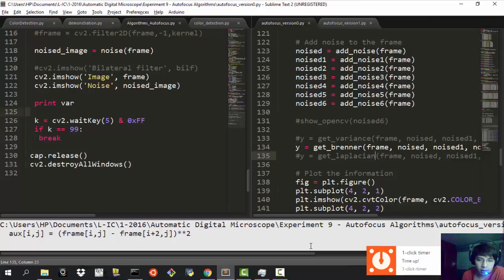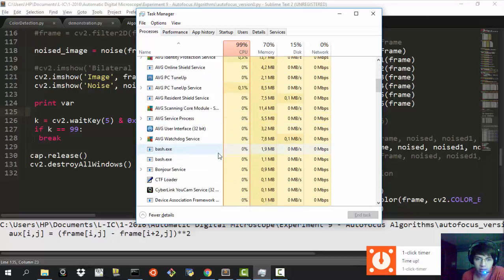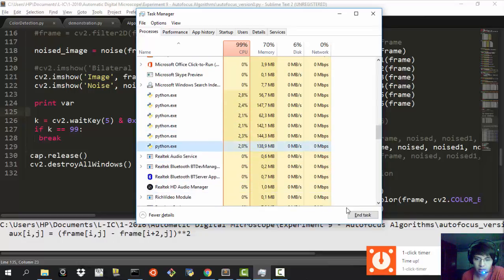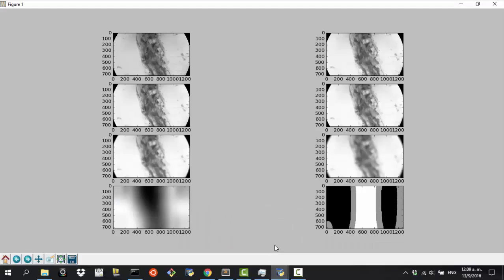And come on, it takes so much time. I just can't believe this takes so much time. I guess this is because of the... oh my god, I have so many Pythons. Maybe that's why. Okay, so finally I just made this work, eliminating all the Pythons, and this is the result that we have.